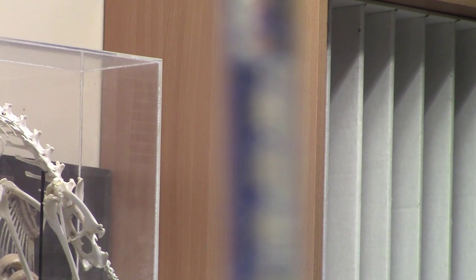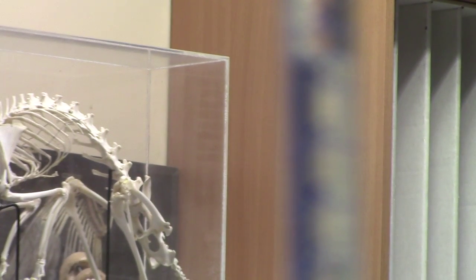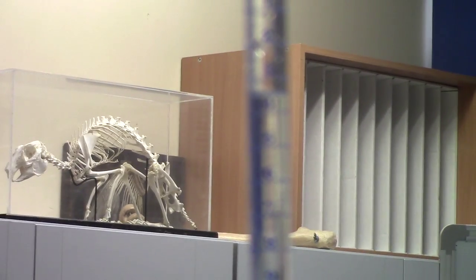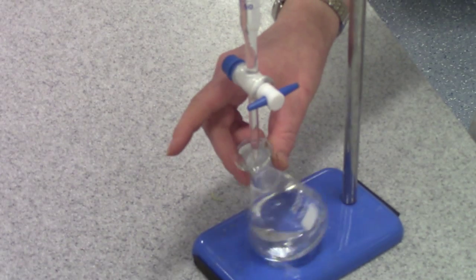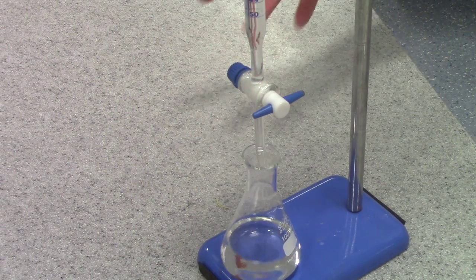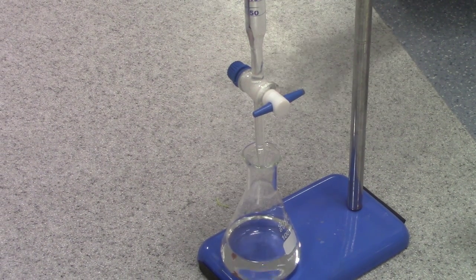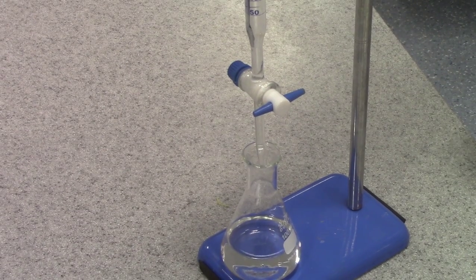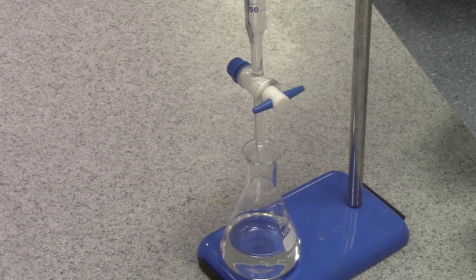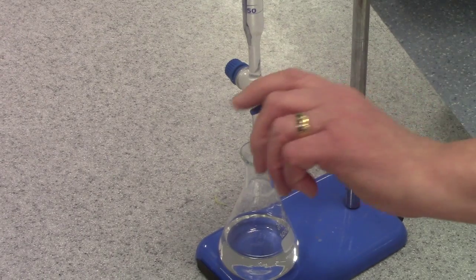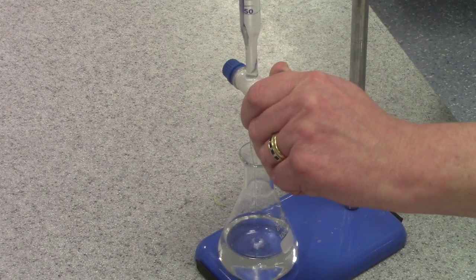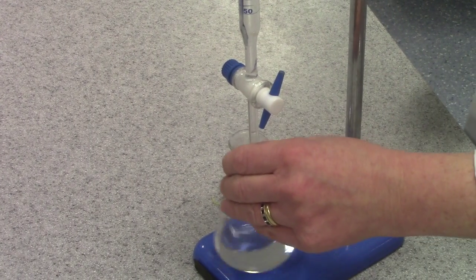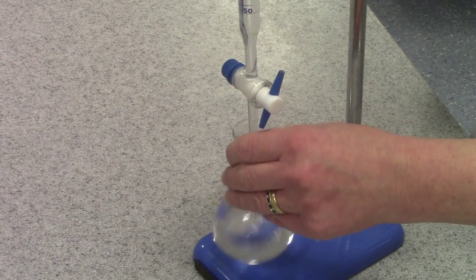I now need to record my start volume and I'm ready to carry out my titration. I've got the analyte and the flask at the bottom. I'll have added a coloured indicator which will enable me to monitor the progress of the reaction and spot when it's come to the end point, when it's completed. I'll open the tap to allow the titrant in, swirling gently to make sure it mixes.